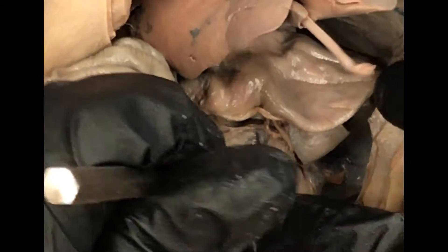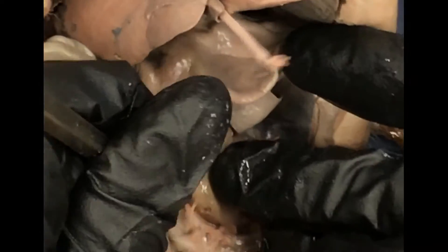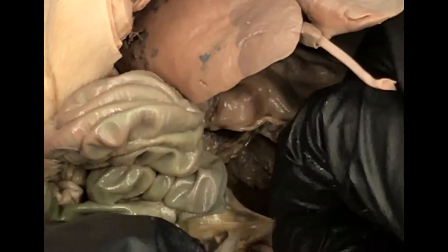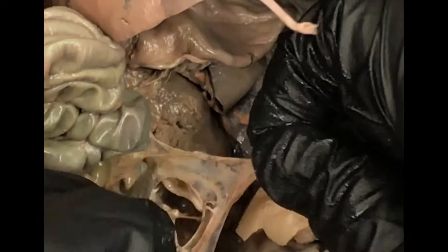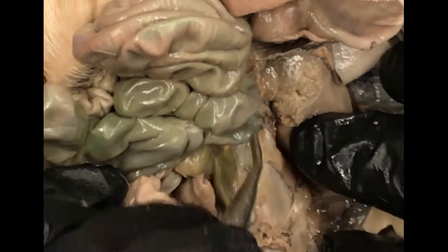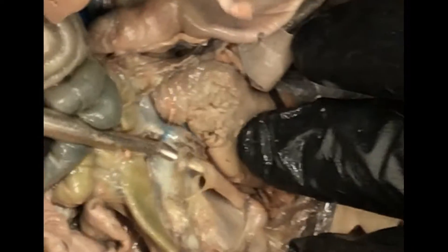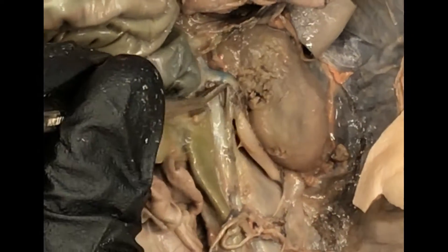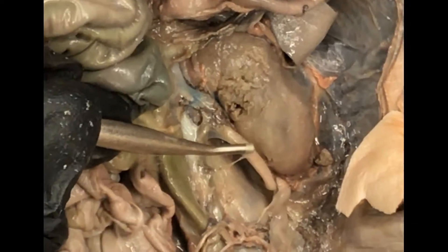And if you can find that and peel away all this peritoneum — because the kidneys are retroperitoneal — if you peel all that away with your blunt probe, you'll be able to start to find branches of the abdominal aorta heading into the kidneys. You'll be able to pull aside a renal vein, which will be blue, and the renal artery coming off of the abdominal aorta. Renal artery, renal vein, ureter, kidney.